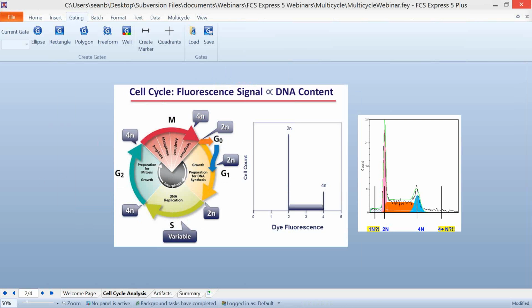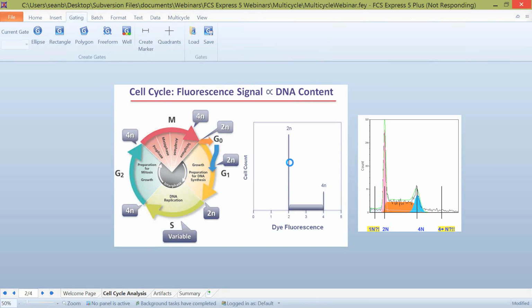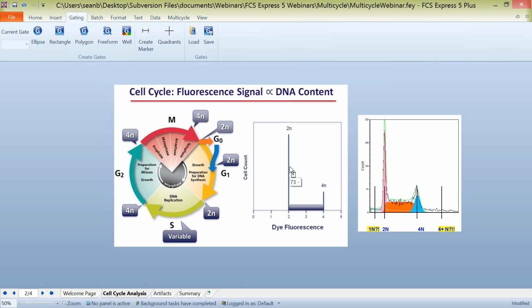When you look at the theoretical model of DNA analysis over here on this screen, you can see that there's a discrete 2n population and a discrete 4n population. Mathematical modeling of this data takes into account many aspects of this theoretical model that are not as simple as it's displayed on this little graphic. The theoretical modeling includes the distance between the 2n and 4n peaks. So you should actually have a ratio here of 2. You should have double the amount of DNA in 4n as you have in 2n. Mathematical modeling is also going to take into account the CV, or the spread, of the G1 and G2 peaks.